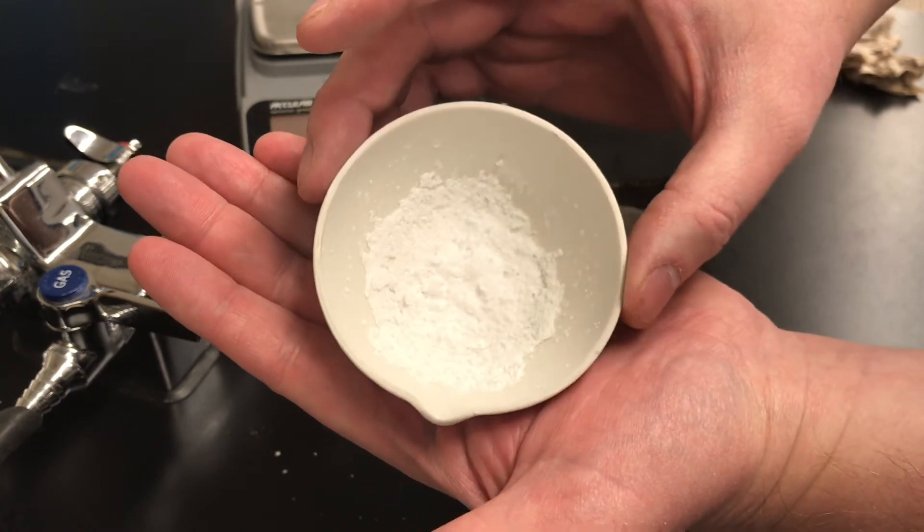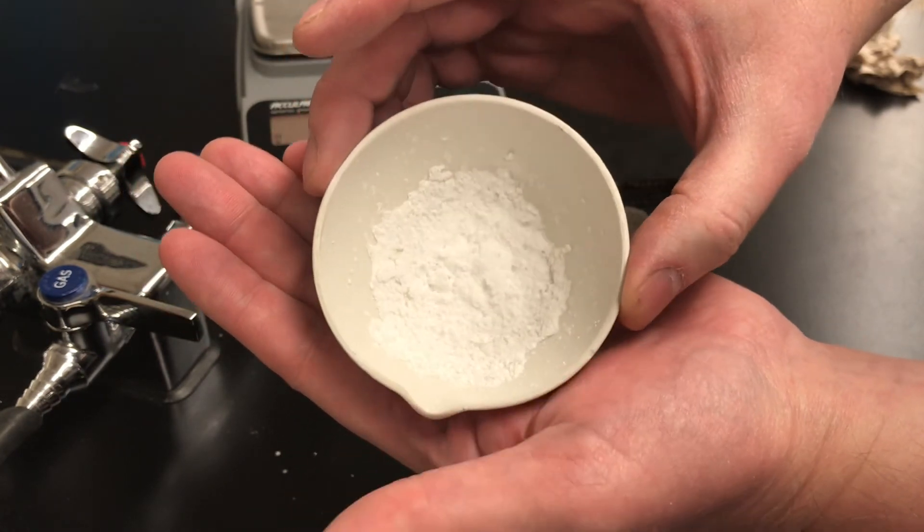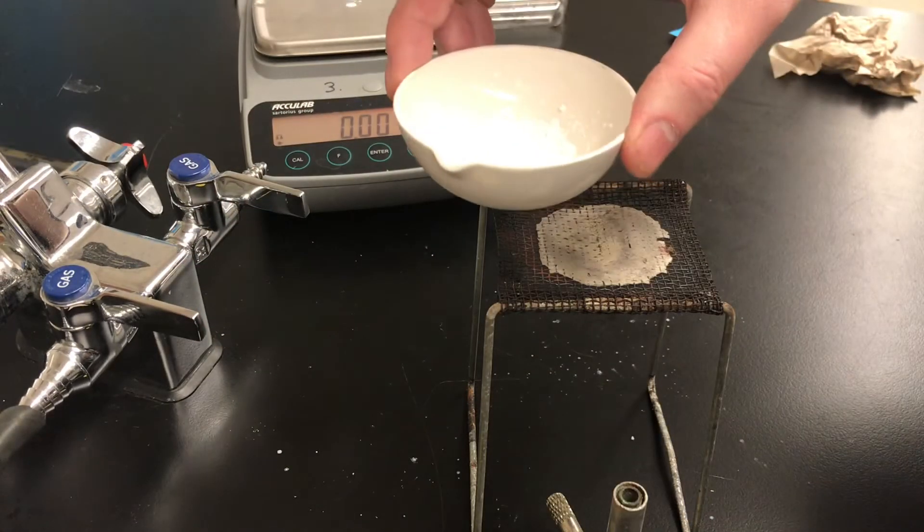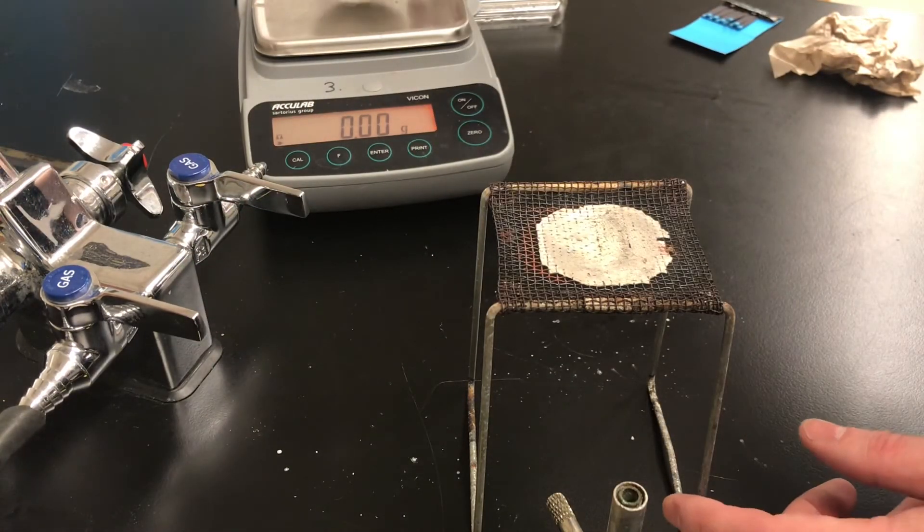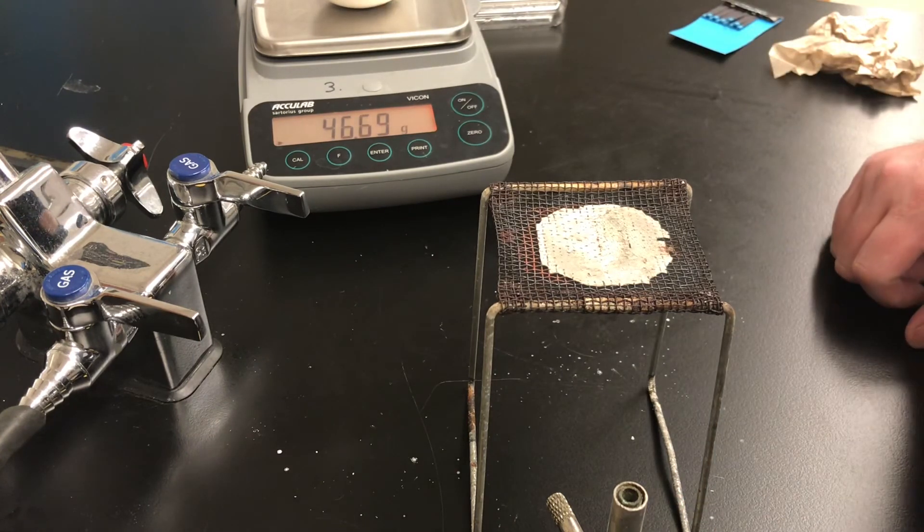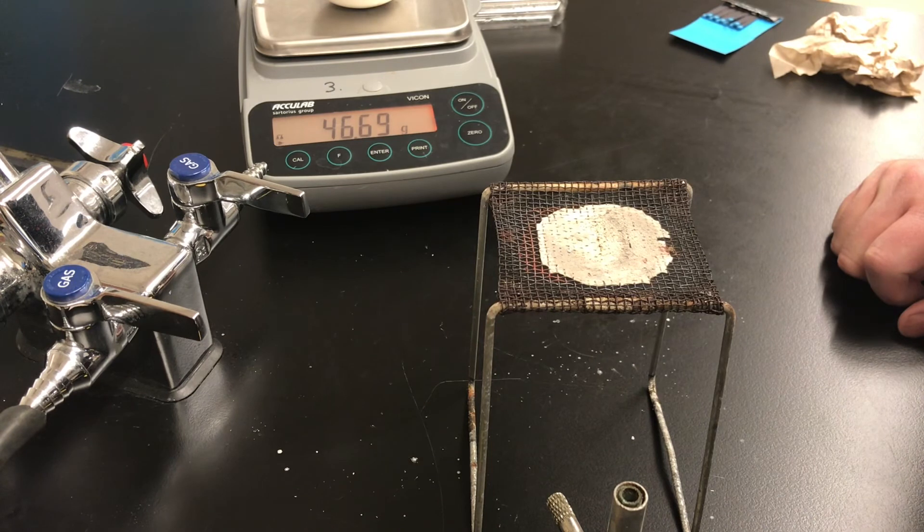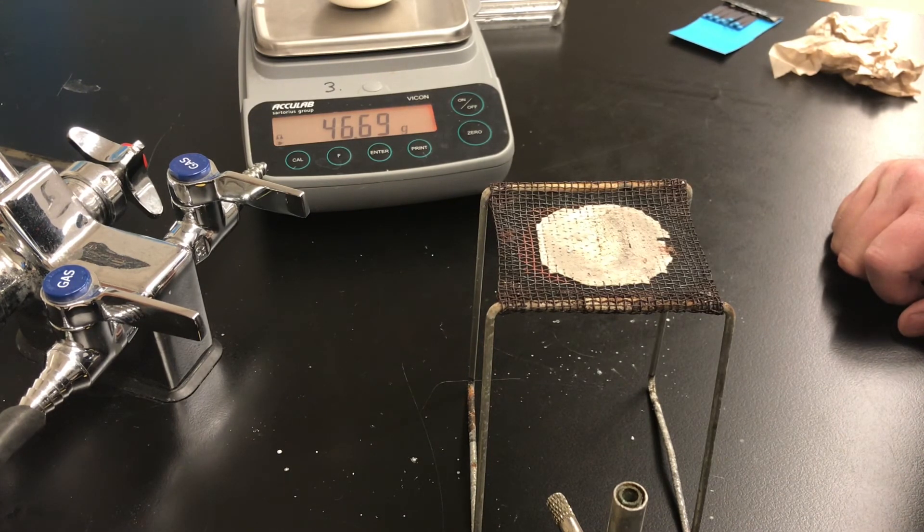You can see in the video the dry salt and there's no evidence of water in the dish. So I'm pretty sure we heated long enough. I'm going to put that back on the electronic balance and you need to record the mass now. This will be the mass of the dish with the dry salt. The third number up in your data section.